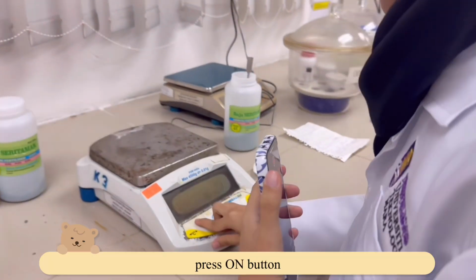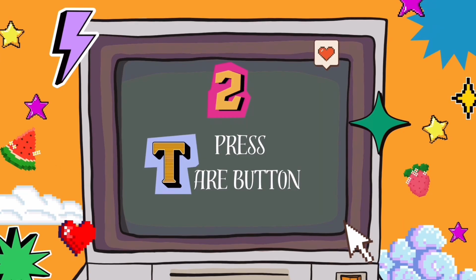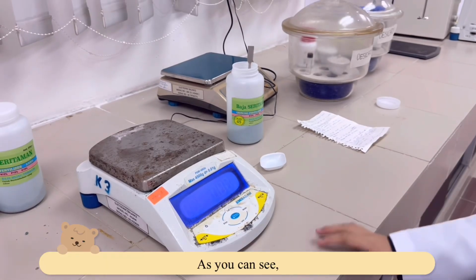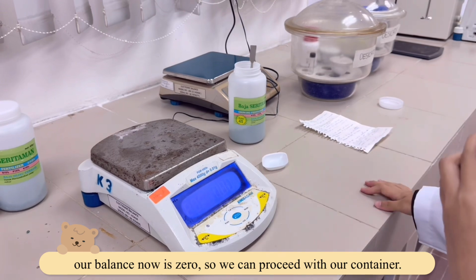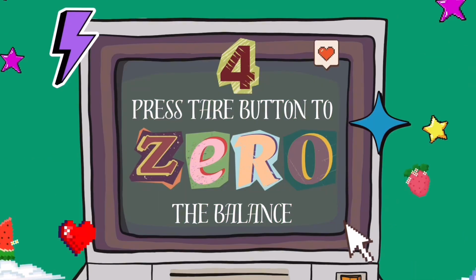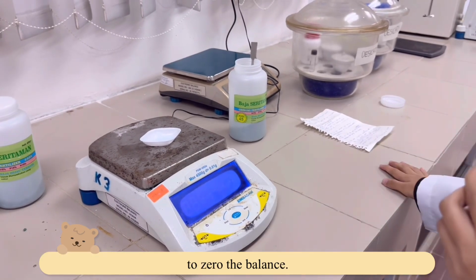First of all, press the on button and wait for a while, and then press the tare button. As you can see, our balance now is 0, so we can proceed with our container. Place our container on the analytical balance and then press the tare button to zero the balance.